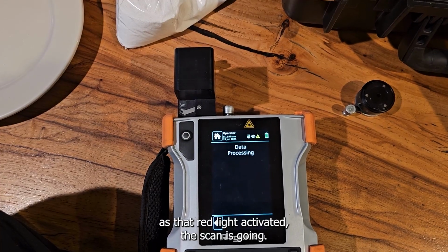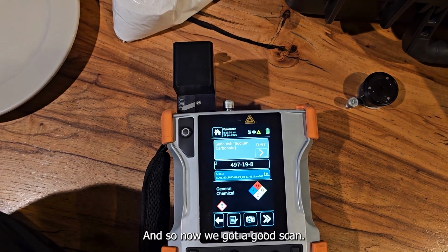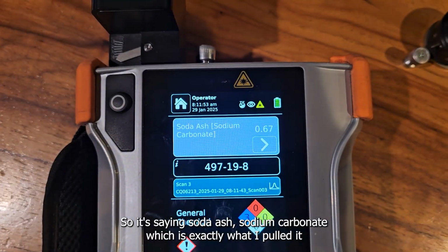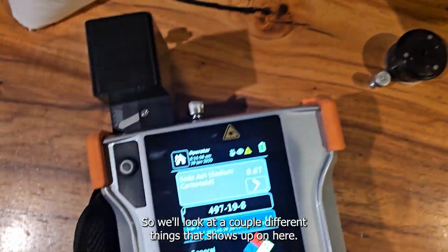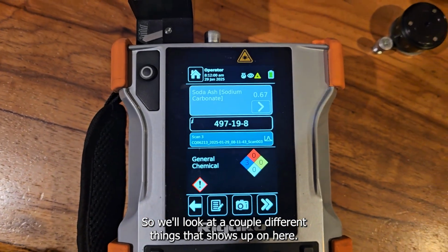You can see as that red light's activated, the scan is going. And so now we got a good scan. So it's saying soda ash, sodium carbonate, which is exactly what I pulled it out of at the station. So we'll look at a couple different things this shows us on here.